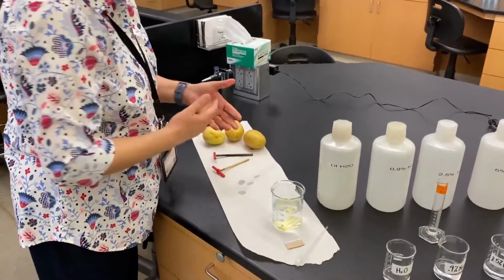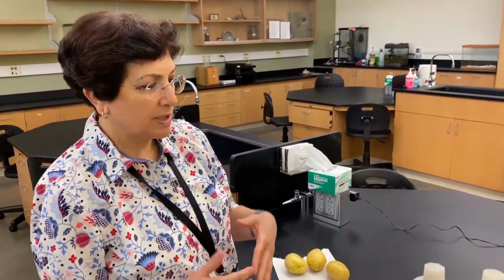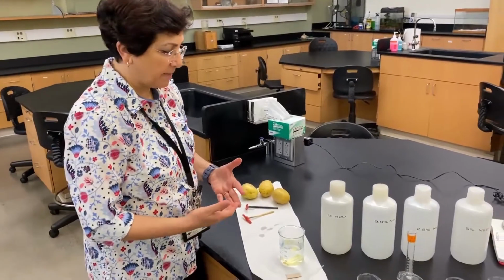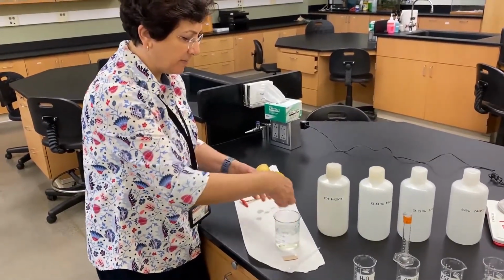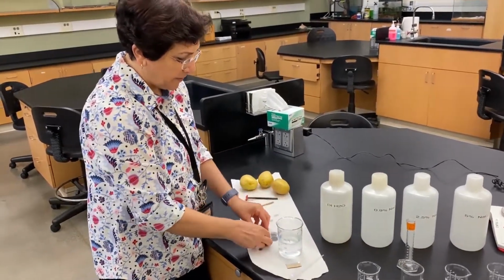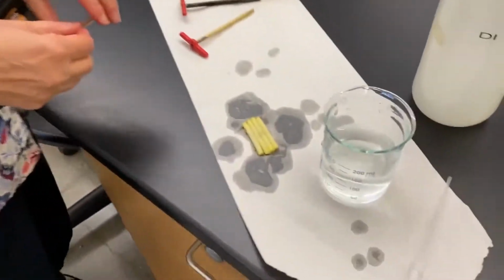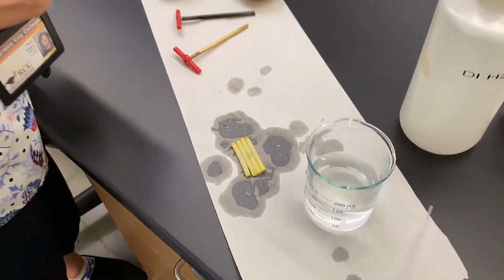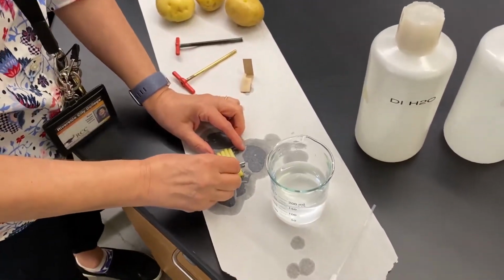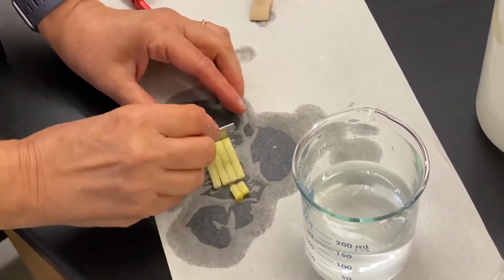Okay, remember when we're setting up an experiment, we are trying to reduce lots of variation that should not be part of the experiment. These are some of your constants, for example. So in this case, I'm going to take the 4 cores of potatoes, and before I start anything, I want to cut them to the same length. Your lab manual says 2 centimeters. If you go 3 or whatever, it's not going to hurt as long as they fit in the beakers and as long as they are of the same size.